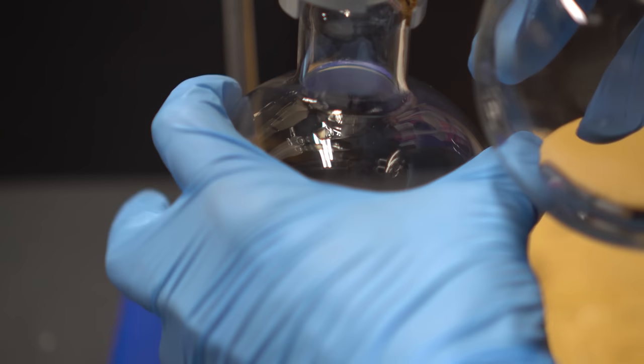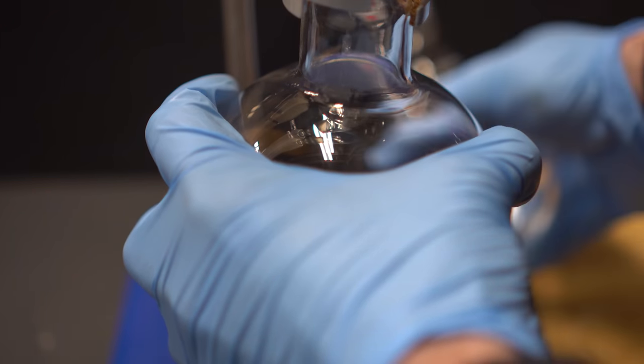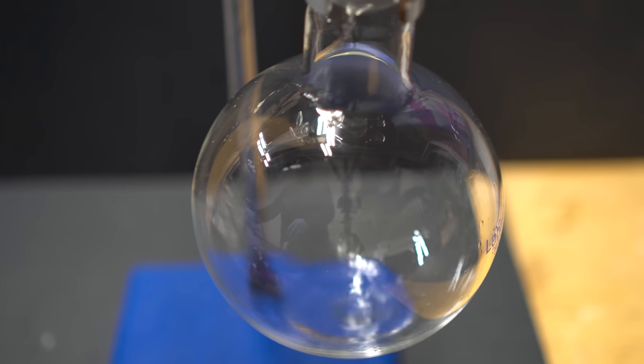Here you can see me switch out the flask at ether's boiling point but you really do not need to do this. I am just a paranoid person and I just wanted everything at the boiling point because I like to be a perfectionist. I did end up putting everything back into my total ether solution.